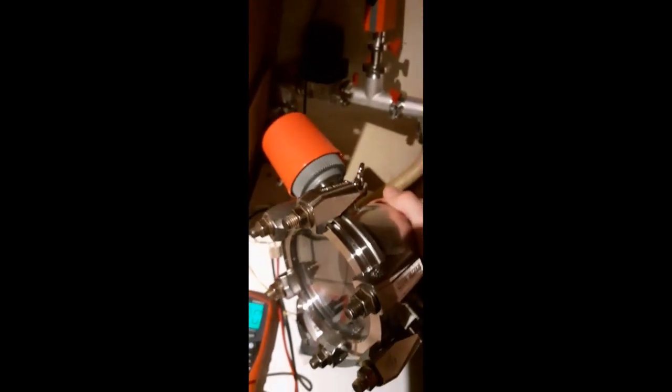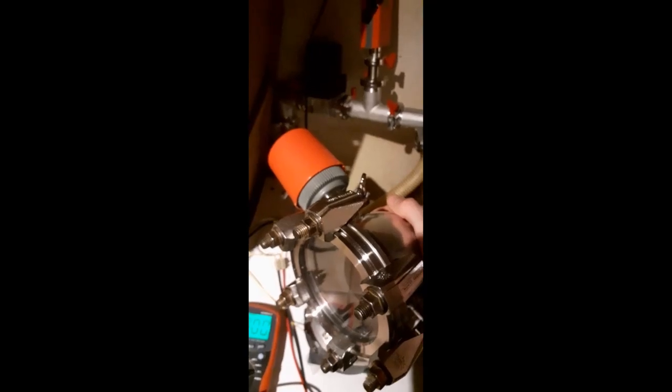And of course, obviously, in a lab, you could have this running for days on end. In a mass spectrometer, a setup like this with a roughing pump like that and a turbo like this would run for half a year without being turned off with no problems. But I can't really do that in a residential home. Either way, everything is ready. So let's turn it on.